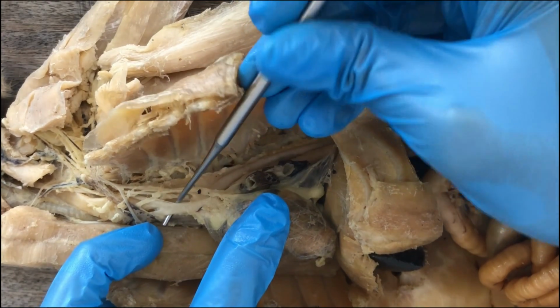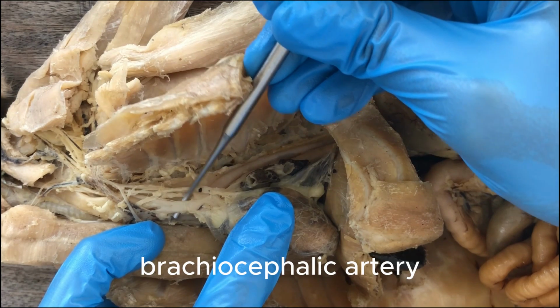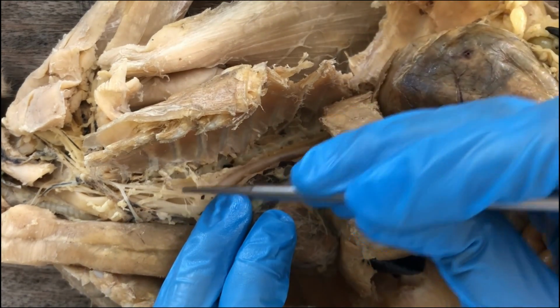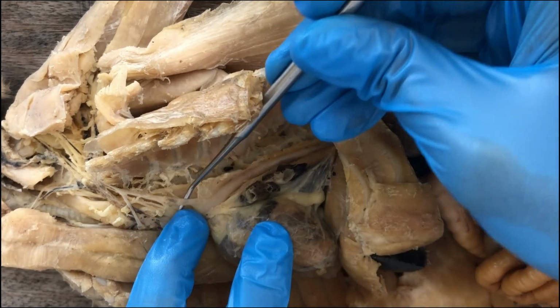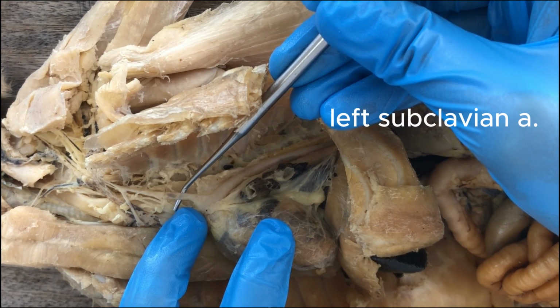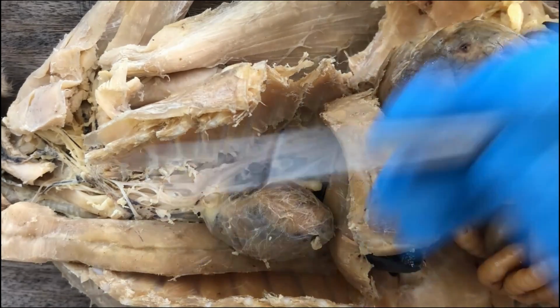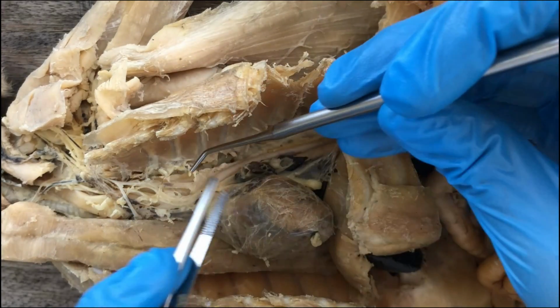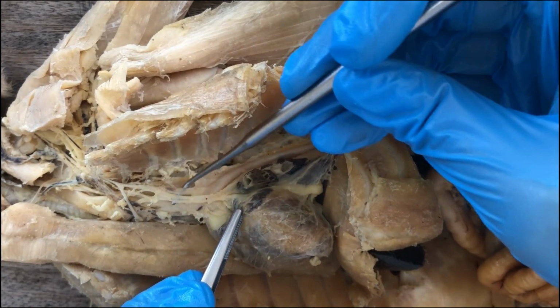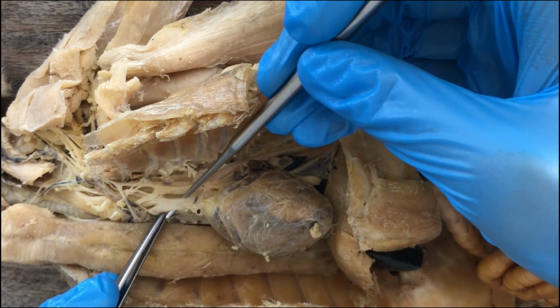This one, the much larger branch, is the brachiocephalic artery, and then the other one toward the left is the left subclavian artery.